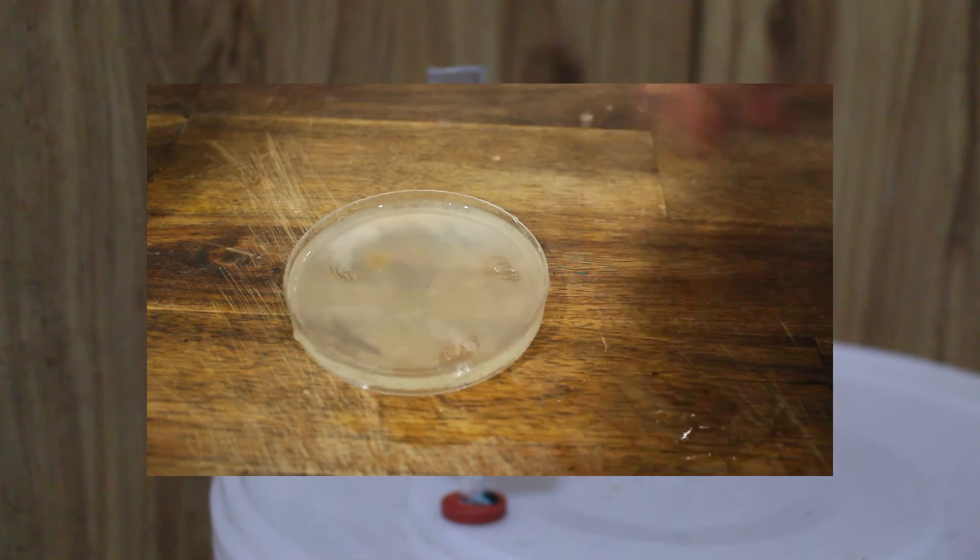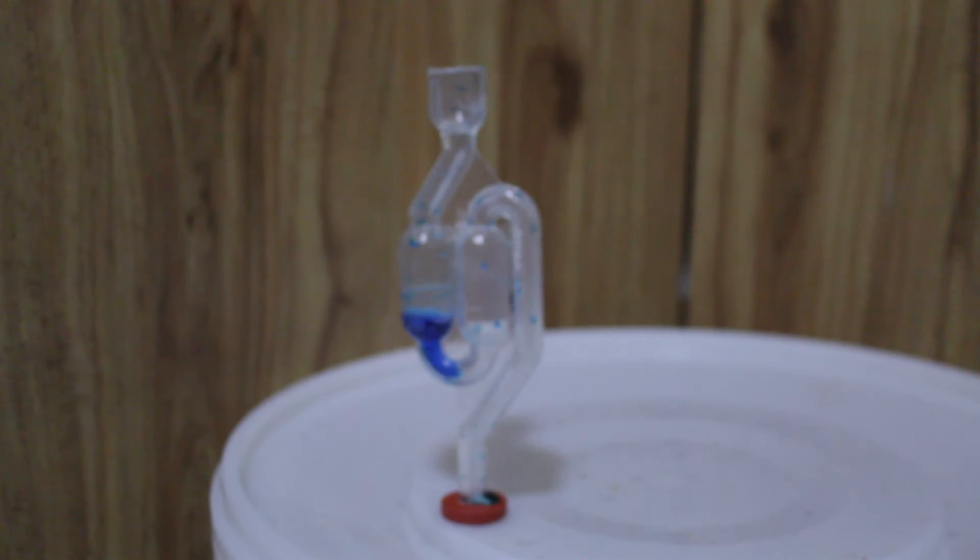The difference is that unlike the powdered method, this should form a thin film, not several clumps and certainly not be a mass. Further, you want a consistent thin film across the entire plate.